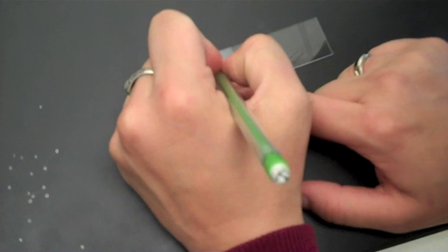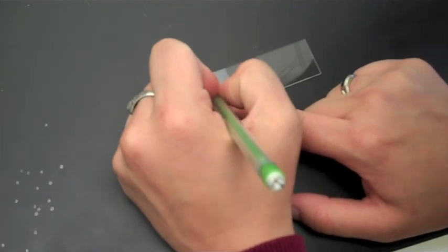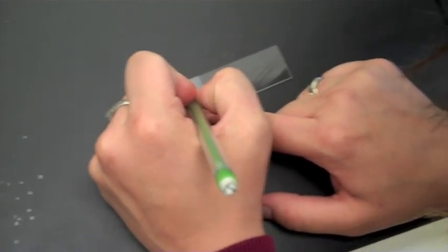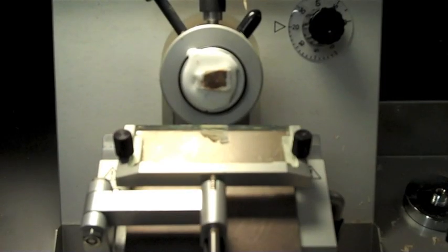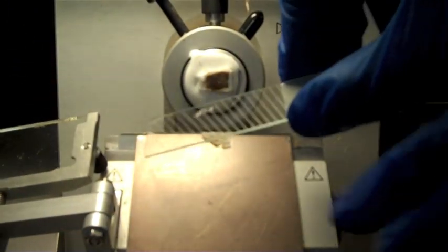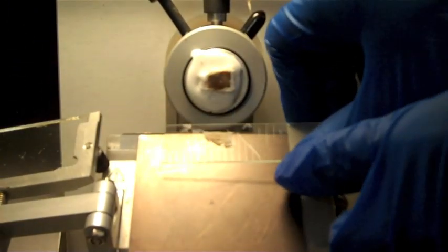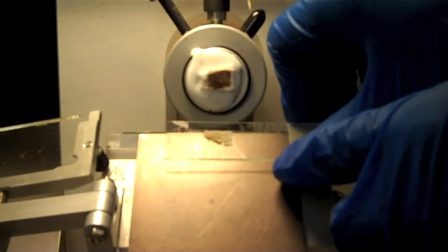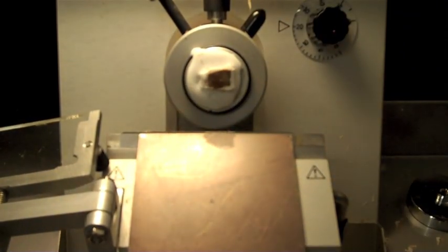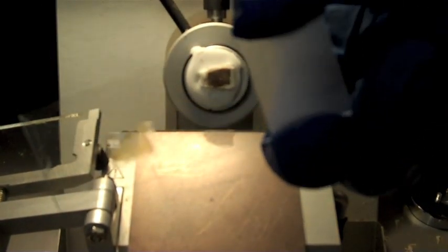Be sure to label your slides. Write on the textured side of the frosted portion. To collect your sections, place the labeled slide face down and press gently. The sample should stick to the slide. It is important to keep the slide inside the cryostat to prevent thawing.